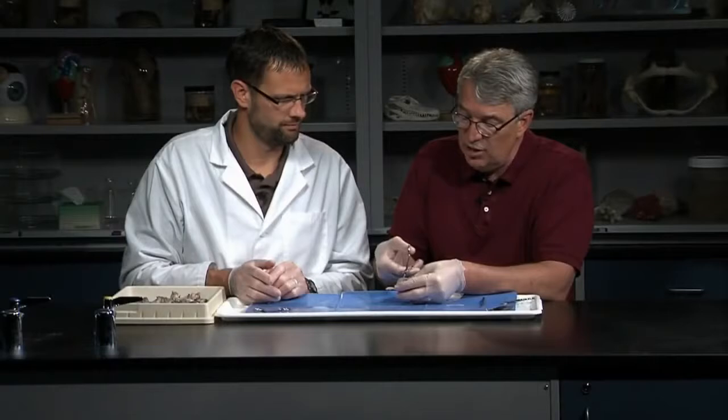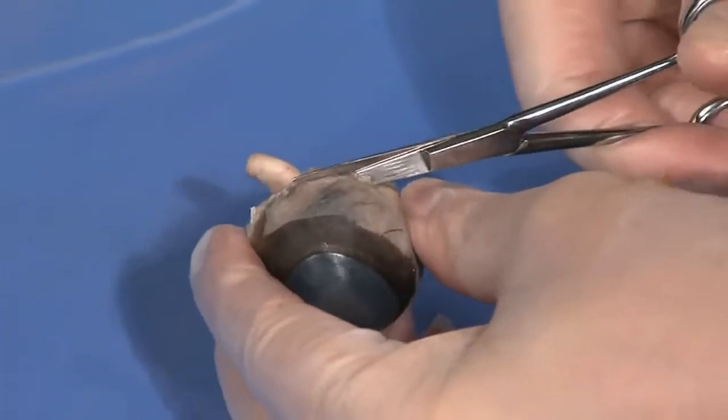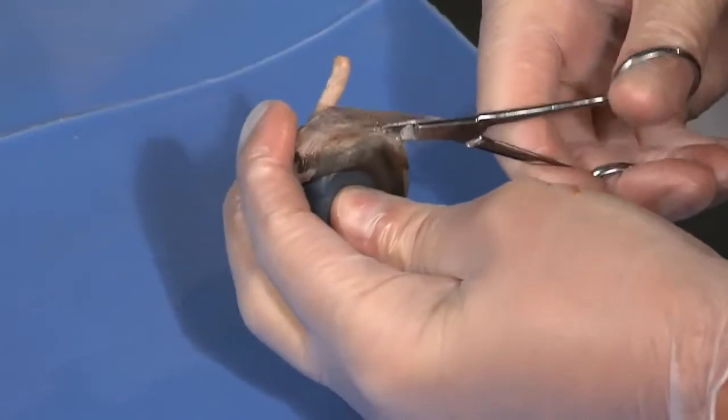You can either use the scalpel to make a slight incision, or you can go in with the scissors and just poke in. You want to poke into the middle of the eye here, kind of halfway — kind of like the equator if it were a globe. Then you just use scissors to extend that cut around. You want to keep the bottom part of the scissors up against the scleral wall.